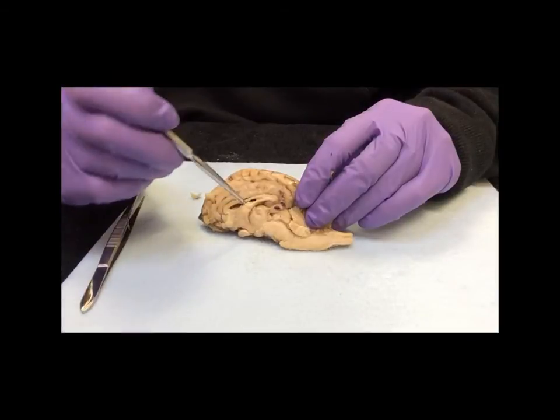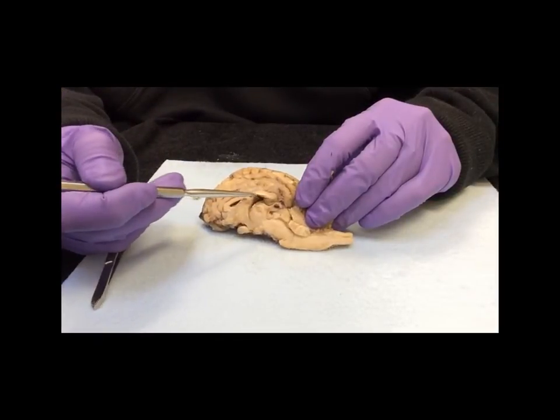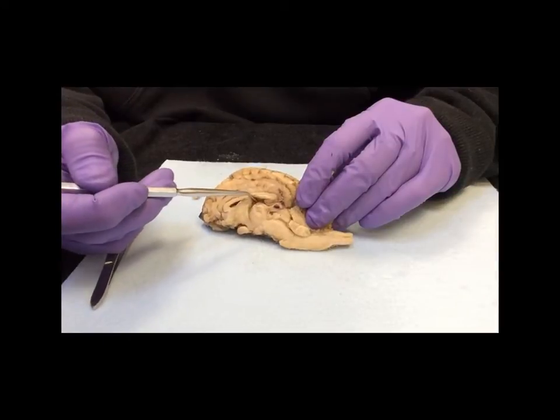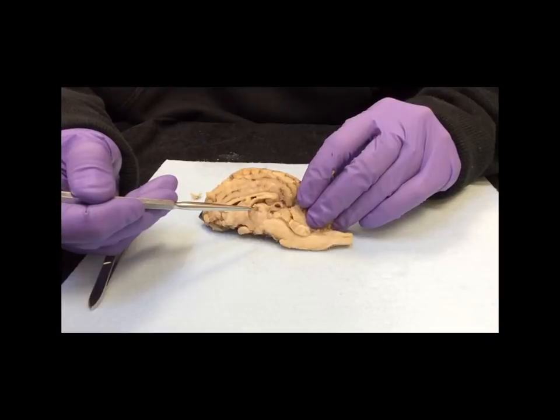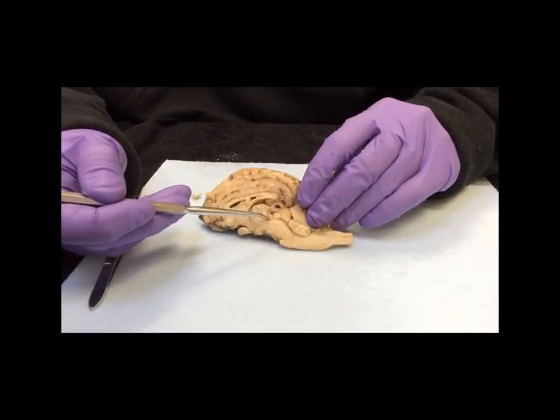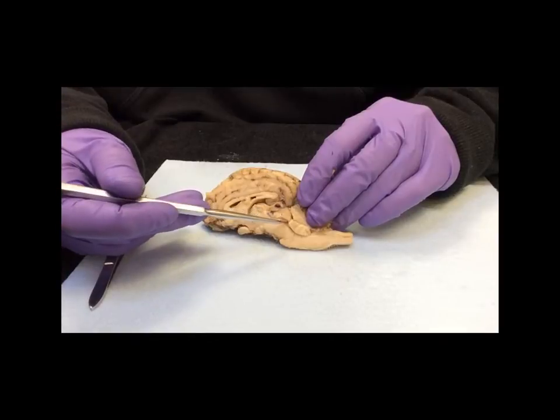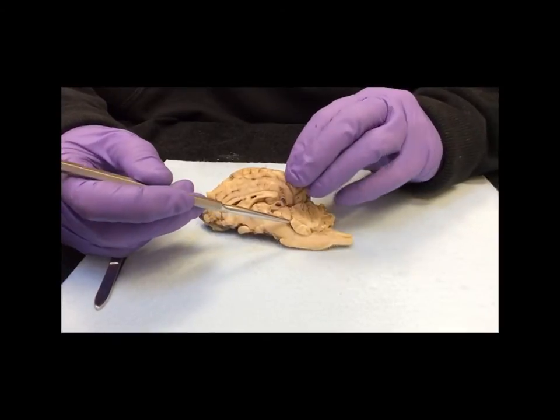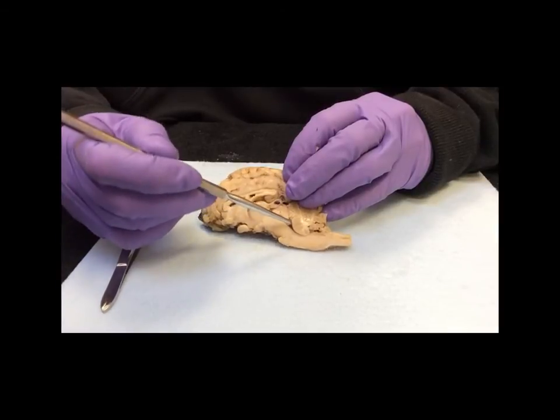It is then going to go through the foramen into the 3rd ventricle, and again you're going to find that choroid plexus in there. The 3rd ventricle is around the thalamus right here. It's then going to go through this little structure here called the cerebral aqueduct, and then go into the 4th ventricle, which will be, as we saw before, underneath the cerebellum.